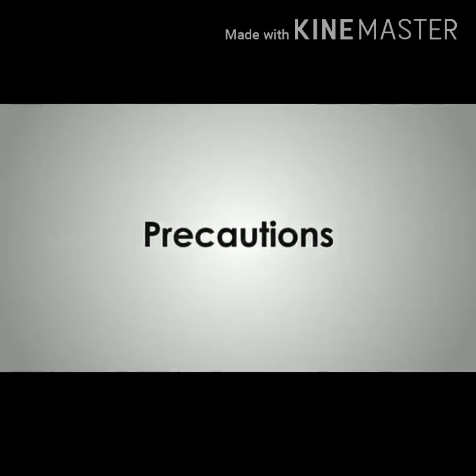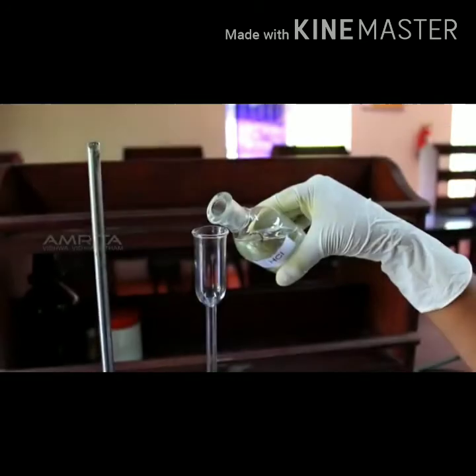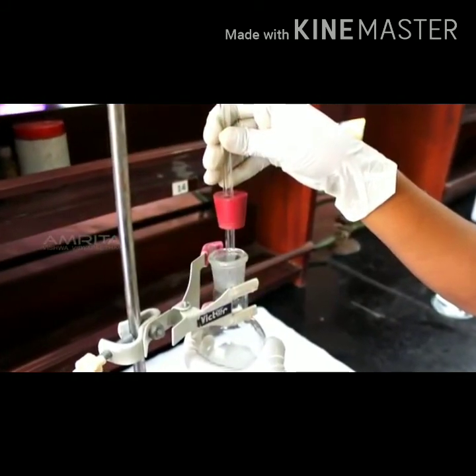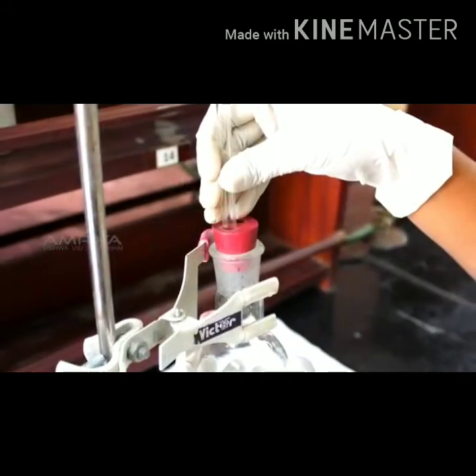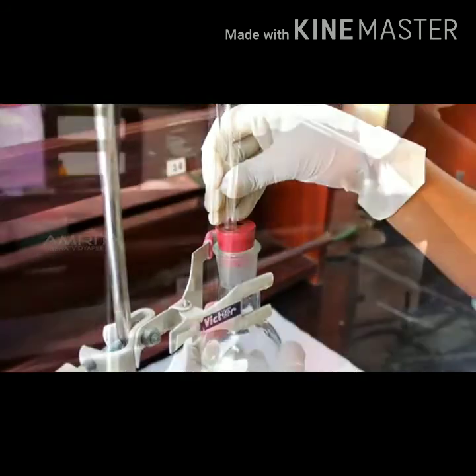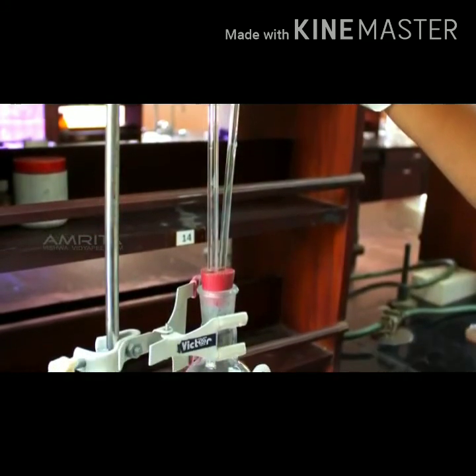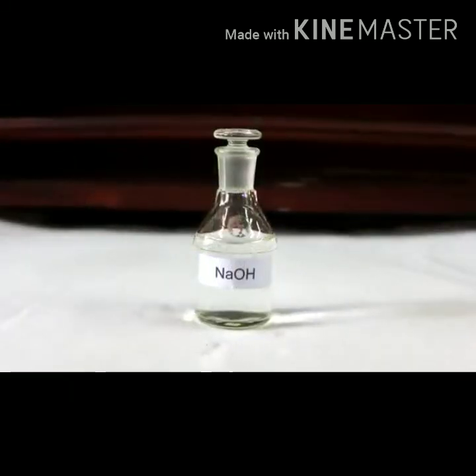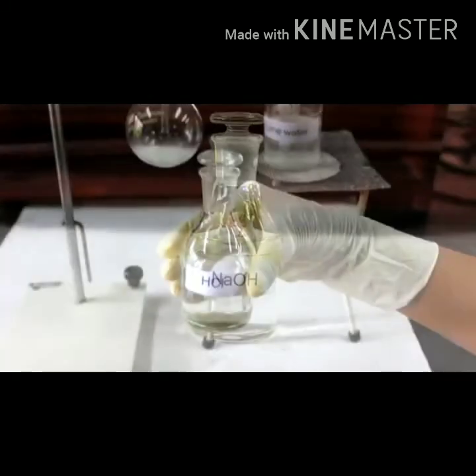Precautions: Add HCl to sodium carbonate only after making the apparatus airtight, otherwise the gas evolved in the reaction will get away through the gap. Handle the chemicals HCl and NaOH carefully as they are harmful.